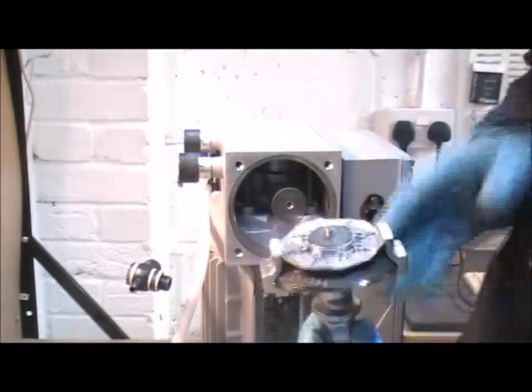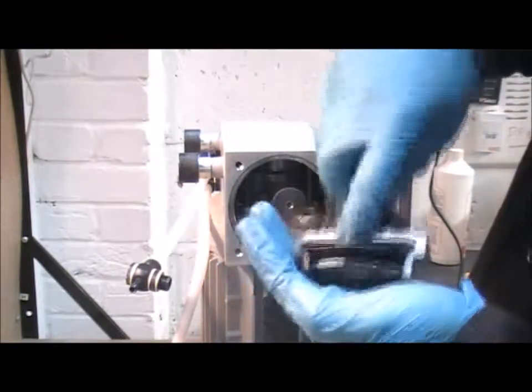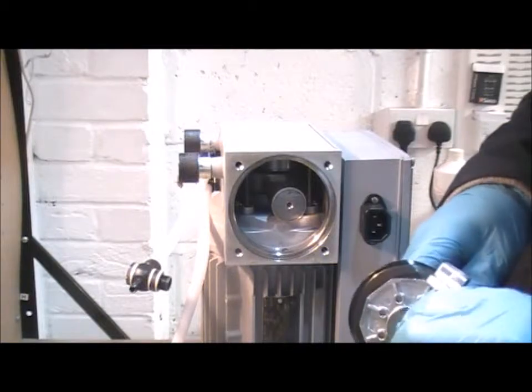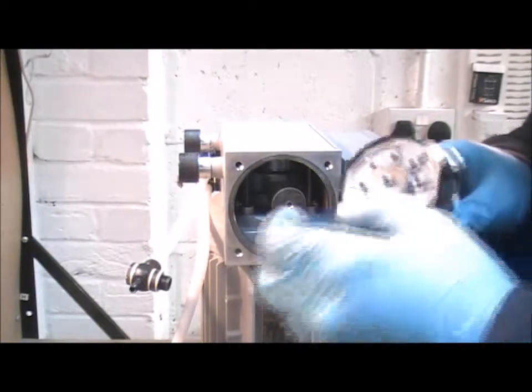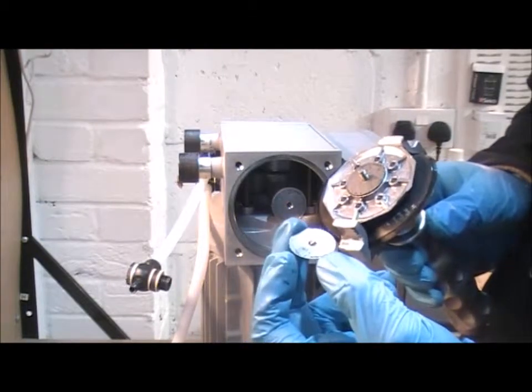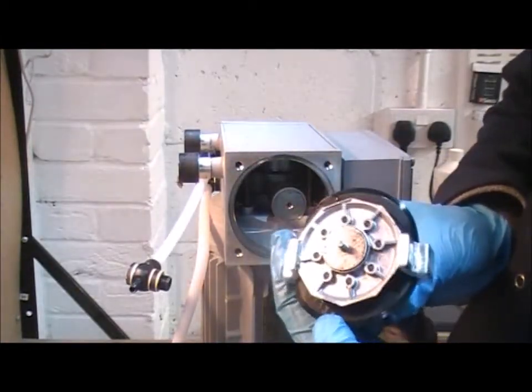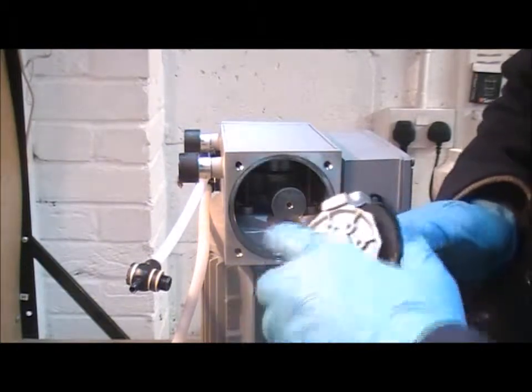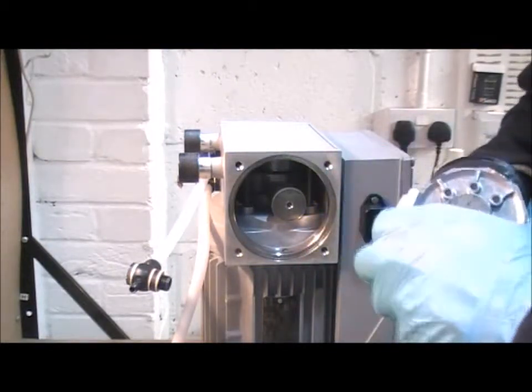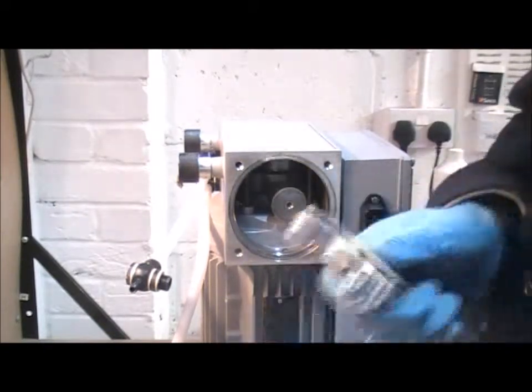Take it downwards, because on the back here, more often than not, you'll find there are one or two thin shims that are well and truly stuck here, but there it comes away. There's a couple of those shims on here, and they need to go back when you reassemble. So now you can see the flats and the way that the tool grips onto them, and you can just pull the assembly back out of the tool. Like so. There we go.